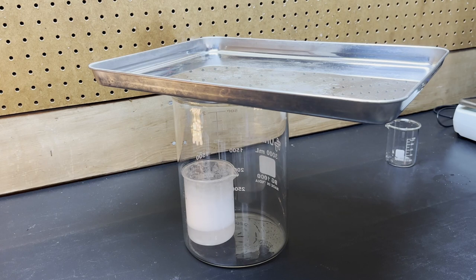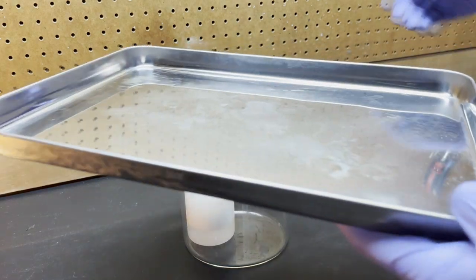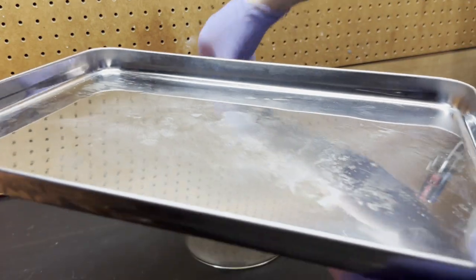Once this is done, left over in the smaller beaker, we have sodium acetate. Sodium acetate can be used to make instant crystals, and we did it in a previous video.